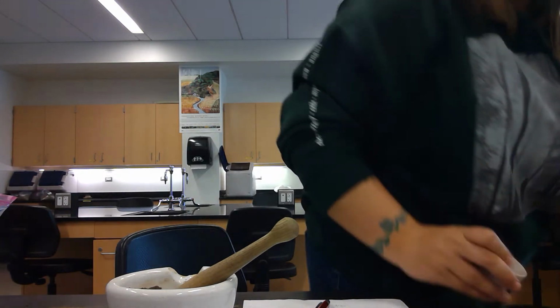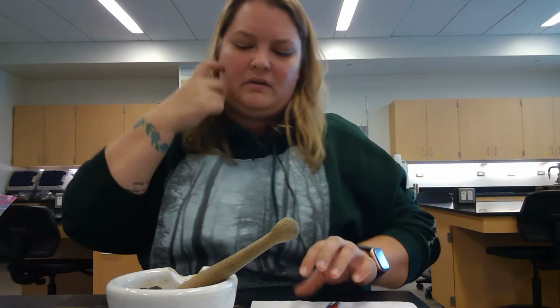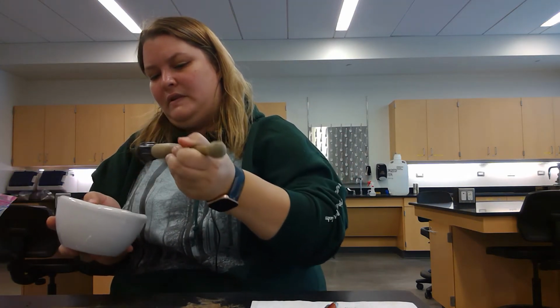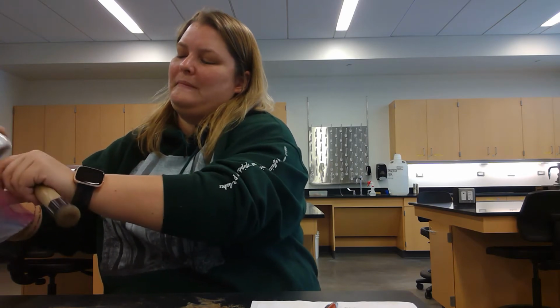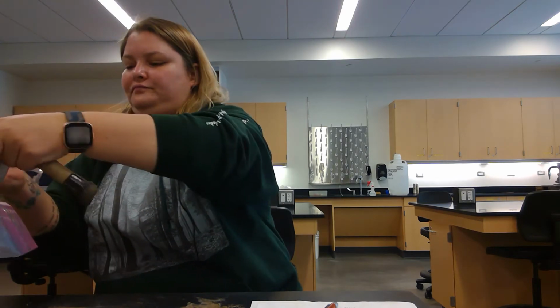All right, so I'm done with this coarse soil. So I'm going to put the leftovers back in the bag.